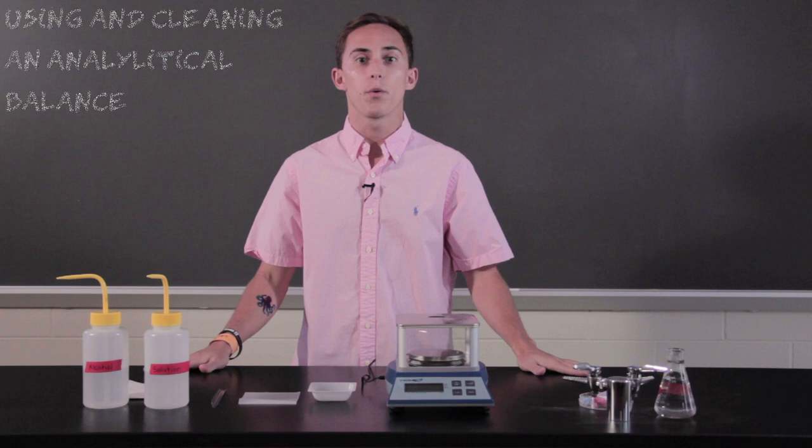Hi guys, my name is Grayson Jacobs and today we're going to learn how to clean and use an analytical balance.